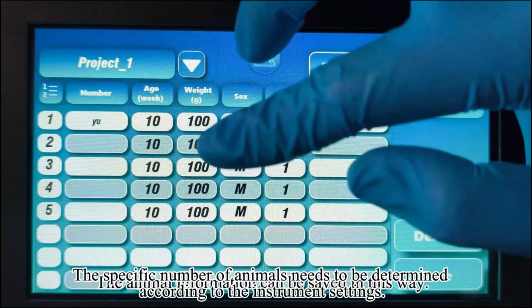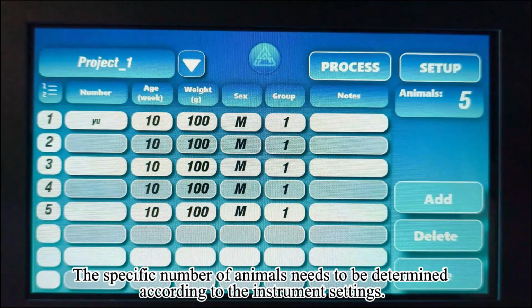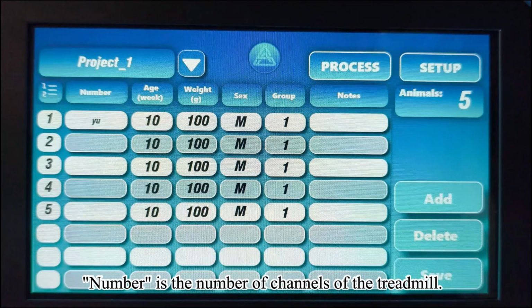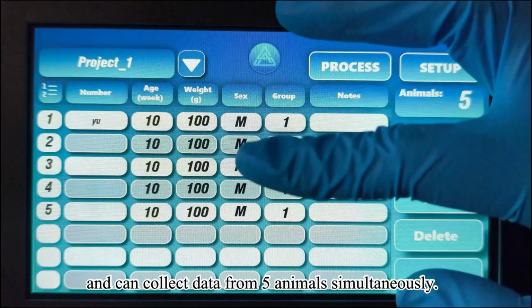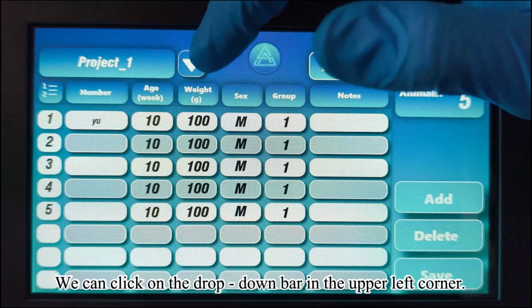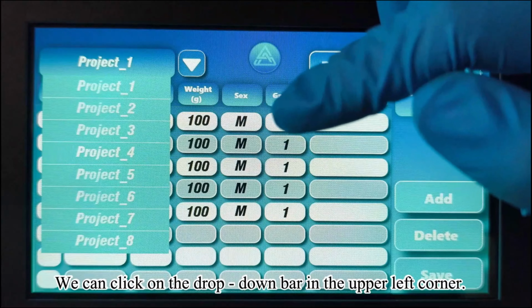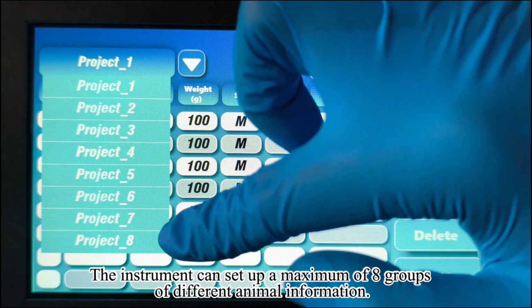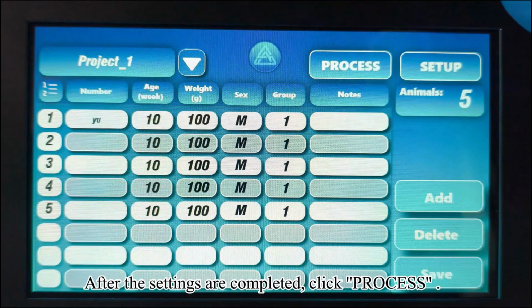The specific number of animals needs to be determined according to the instrument settings. Number is the number of channels of the treadmill. Our treadmill can support a maximum of 5 channels and can collect data from 5 animals simultaneously. We can click on the drop-down bar in the upper left corner. The instrument can set up a maximum of 8 groups of different animal information. After the settings are completed, click Process.